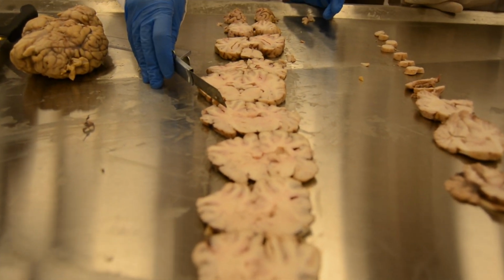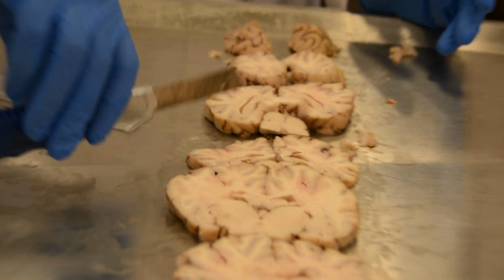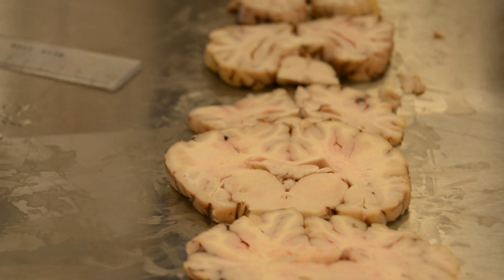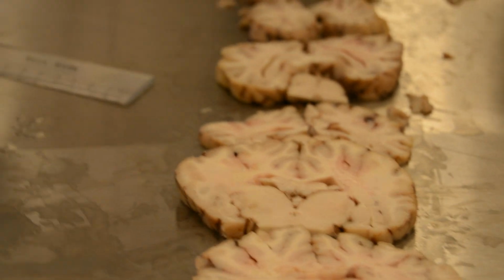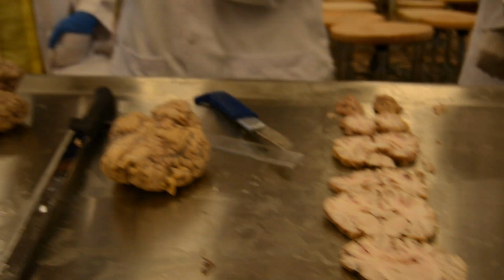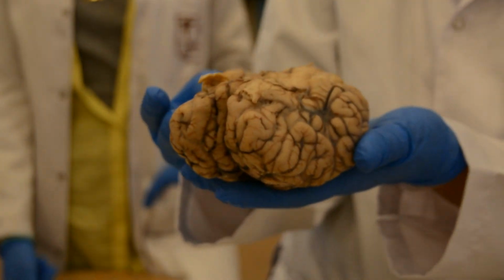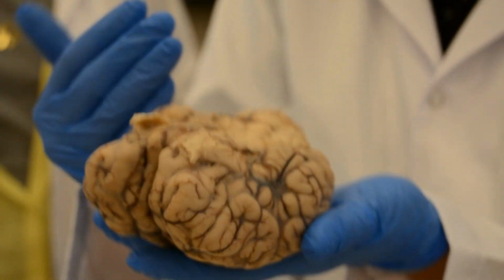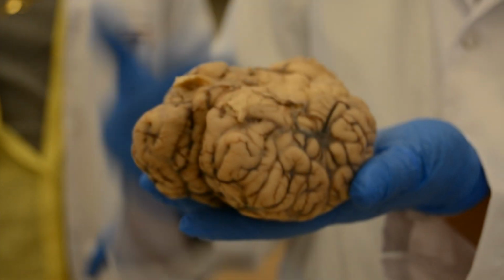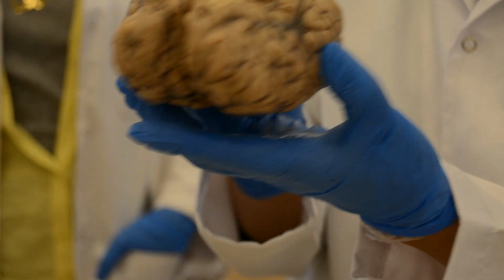The second watershed area, I can take it here, or at the level of the mammillary body, I can take both. Is it clear for all of you? This brain is supplied with two vascular systems, the internal carotid system and the posterior cerebral from the vertebrobasilar system.